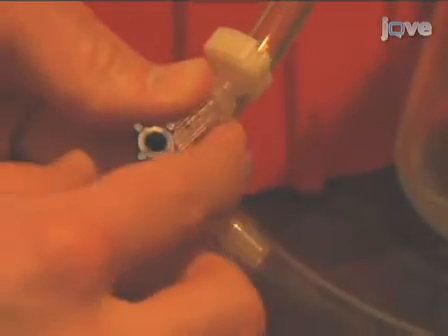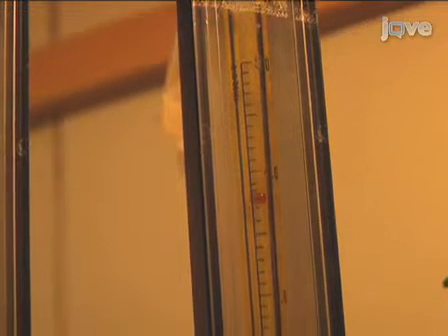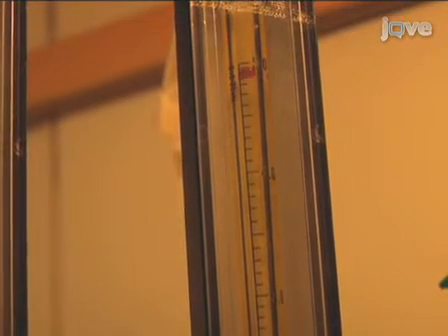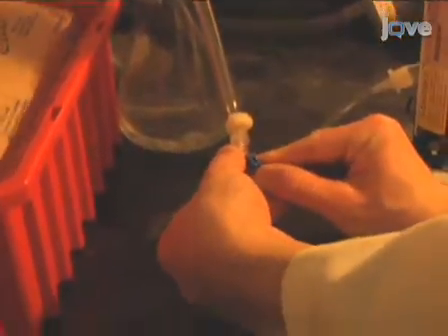To begin the assay, switch the Y valve in the airflow system such that the air will only flow to the flow meter. Turn on the air and ramp the air up to the desired speed. Any speed within 4 to 6 liters per minute will work. We generally use 5 to 5.5 liters per minute. Once the desired airspeed is attained, switch the Y valve so that the air flows to the locomotion chamber.